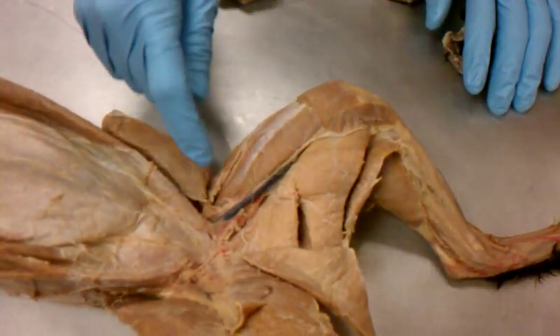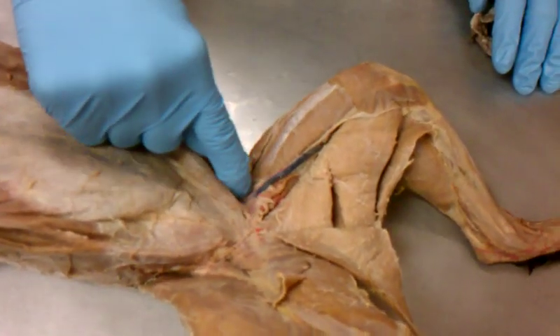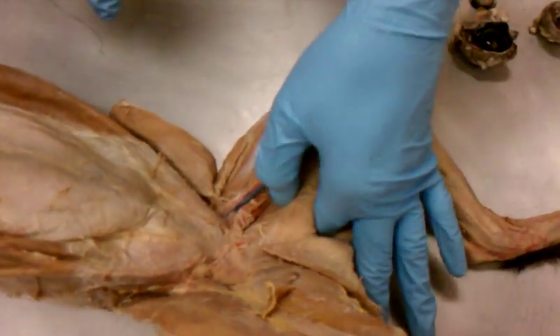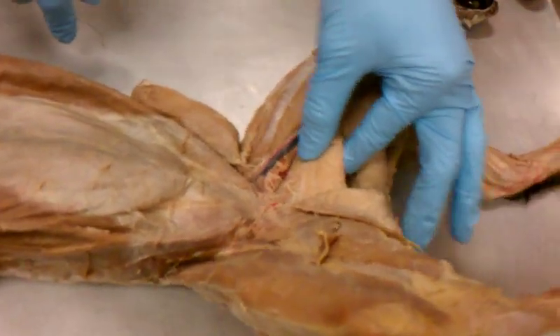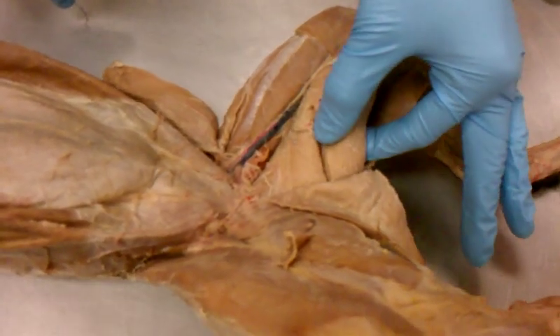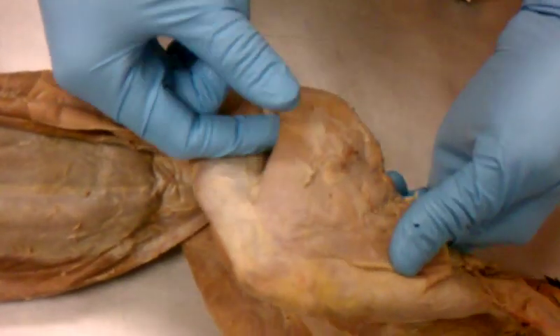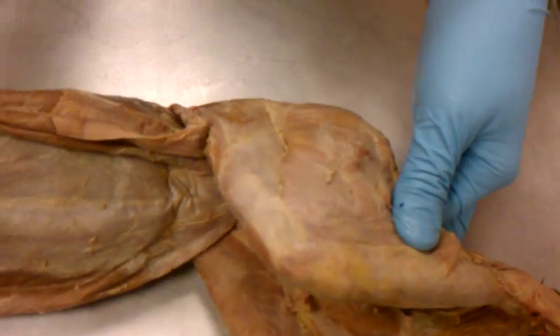Is that blue line? No, that's actually a vein. It's underneath here. It's all that meat underneath here. So this is the adductor femoris. And then you have this triangular one, which is pretty big. That's the M that I told you how to remember. Semimembranosus. And then semitendinosus. And then on the outside is your, this. What is this? We said it earlier. Biceps femoris, because it goes over the femur.